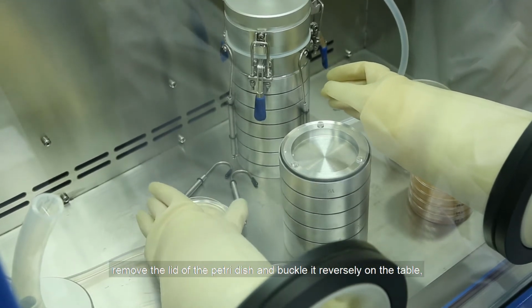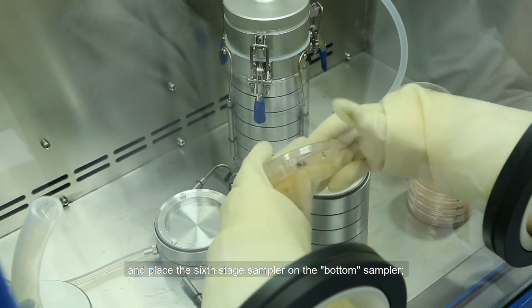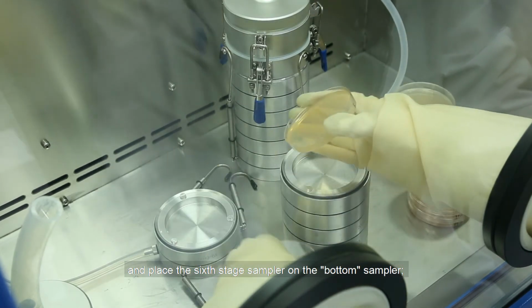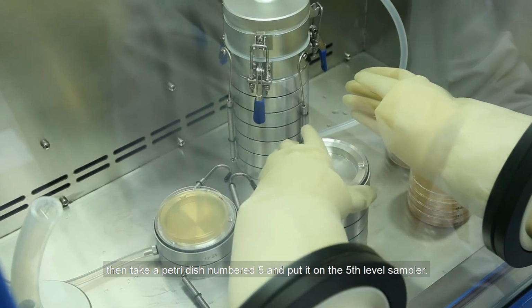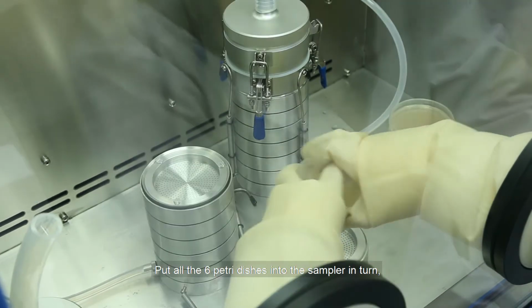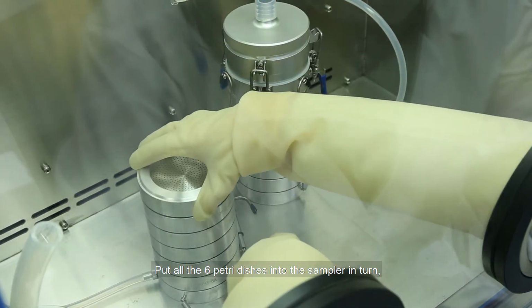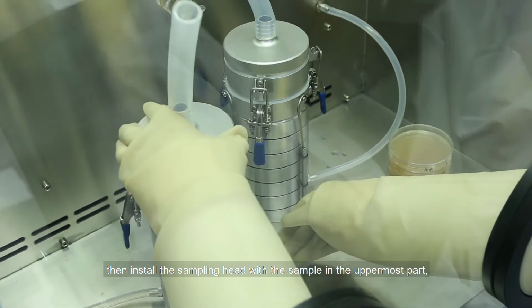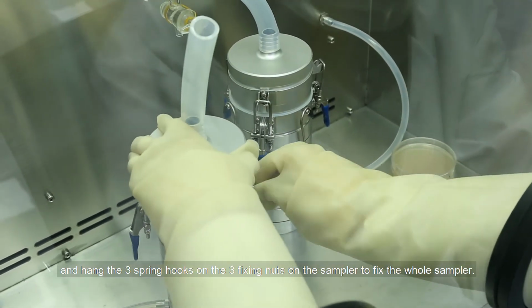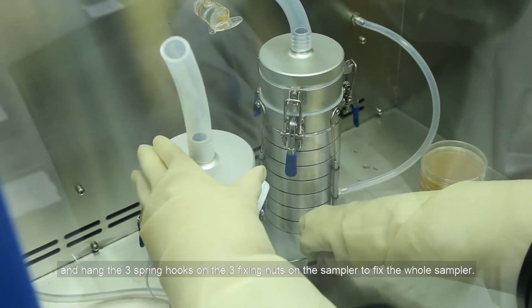Remove the lid of the petri dish and buckle it reversely on the table and place the 6th stage sampler on the bottom sampler. Then take a petri dish numbered 5 and put it on the 5th level sampler. Put all the 6 petri dishes into the sampler in turn. Then install the sampling head with the sample in the uppermost part, and hang the 3 spring hooks on the 3 fixing nuts on the sampler to fix the whole sampler.